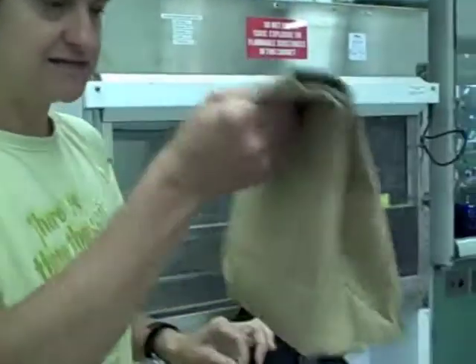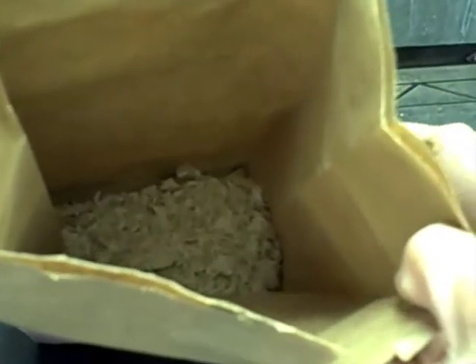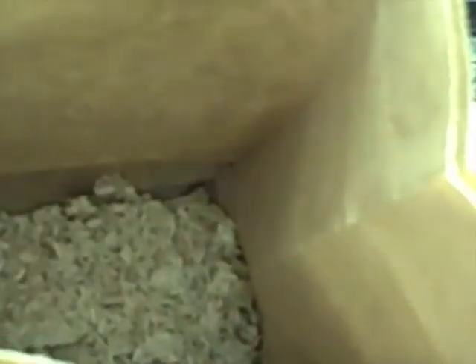We'll grow the fungus on that. It'll colonize the solid substrate and sporulate, and then we can extract the spores. I've got some bags here. It's the spores that you would then apply to the mosquitoes — the spores are the things that will germinate and infect the mosquitoes. So this is some dry fungus on some rice. You can see the white and you can see the rice, and if I just tap this, you'll see some of the spores come off — it looks like dust.